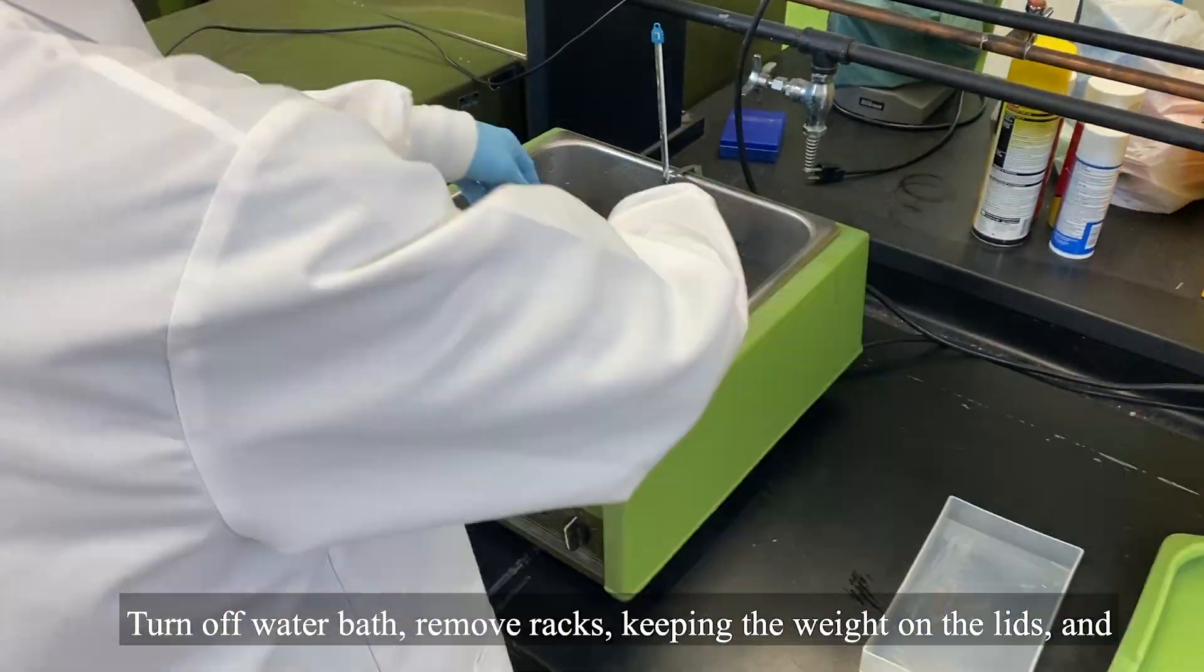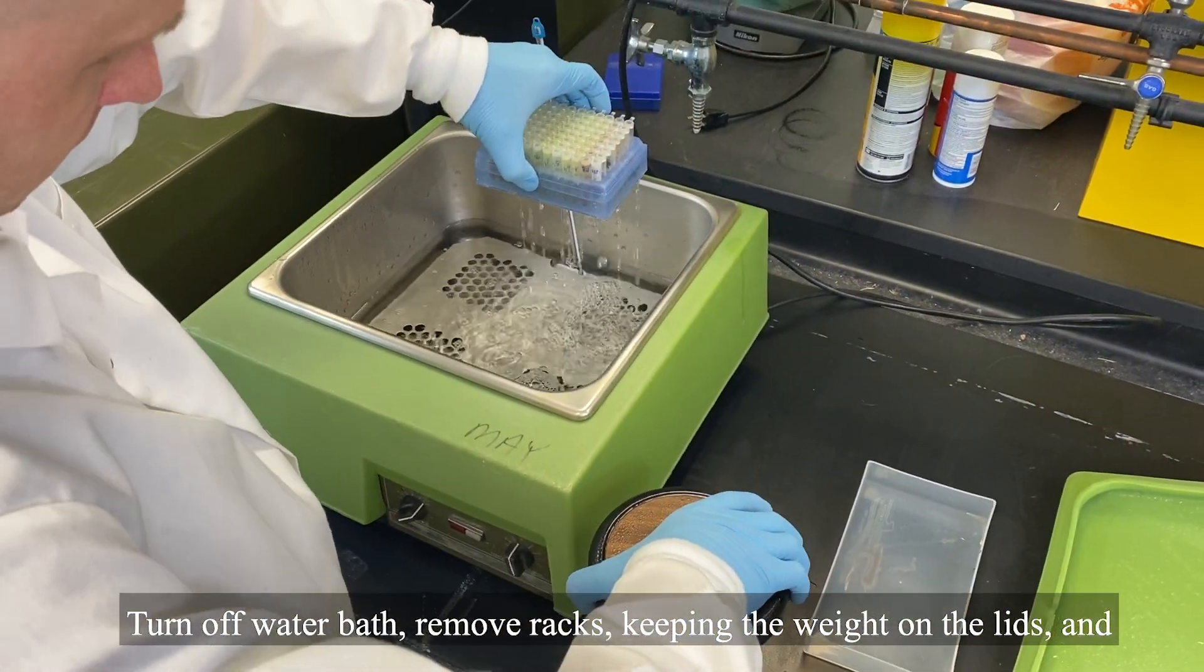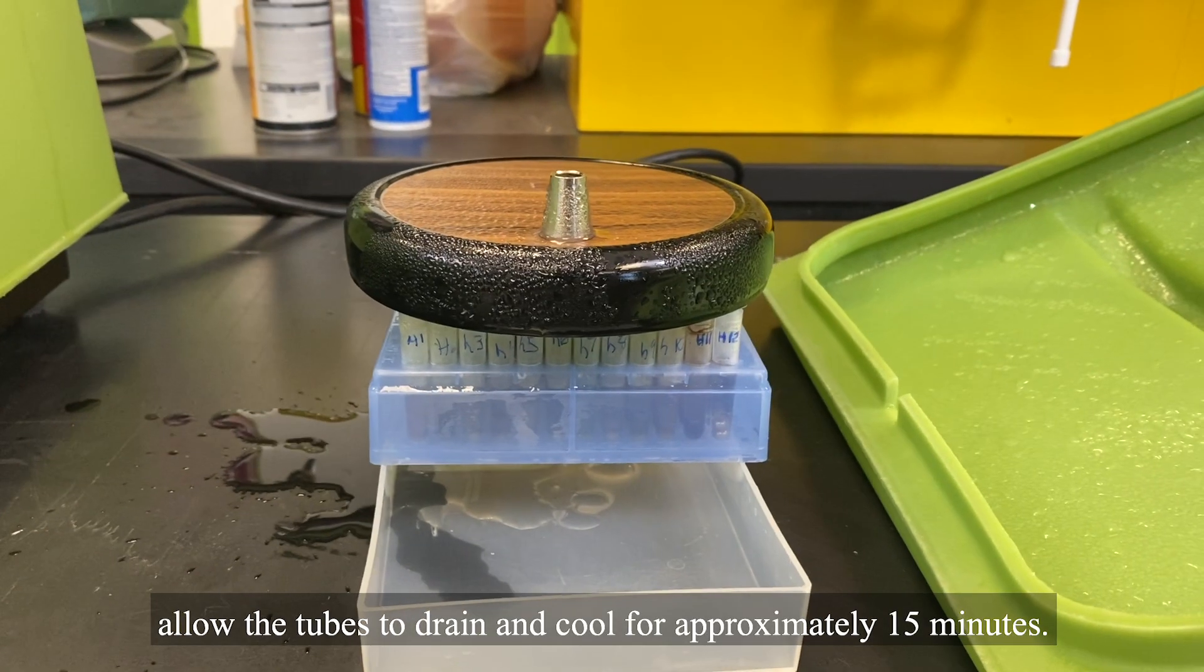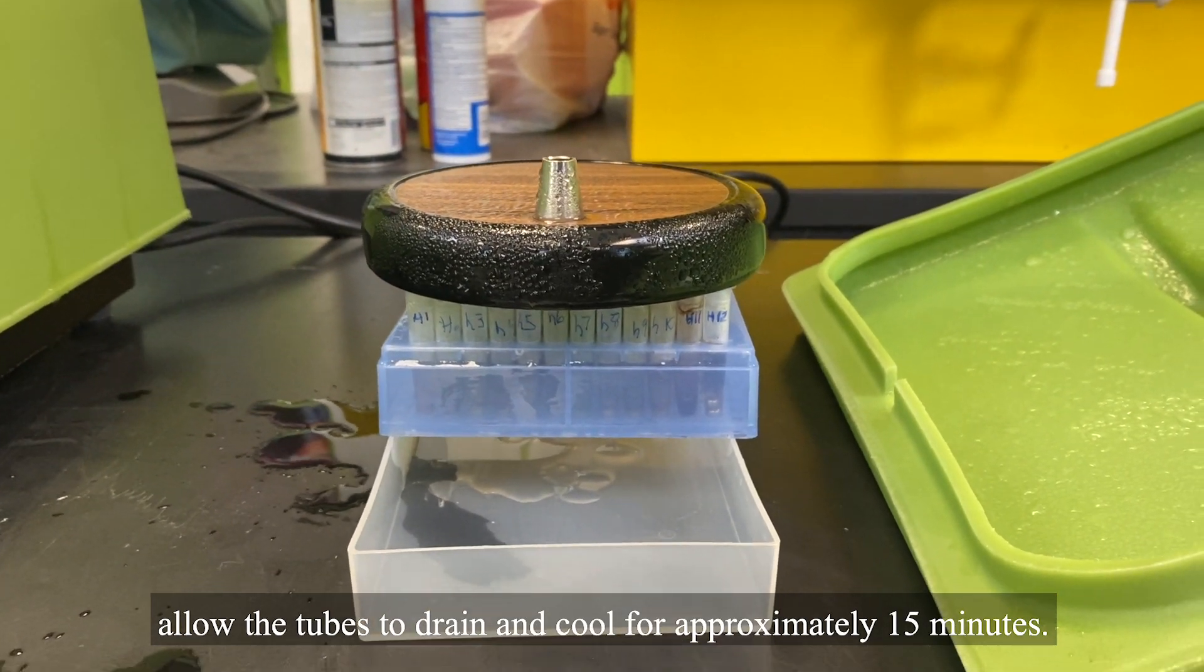Turn off water bath, remove racks, keeping the weight on the lids, and allow the tubes to drain and cool for approximately 15 minutes.